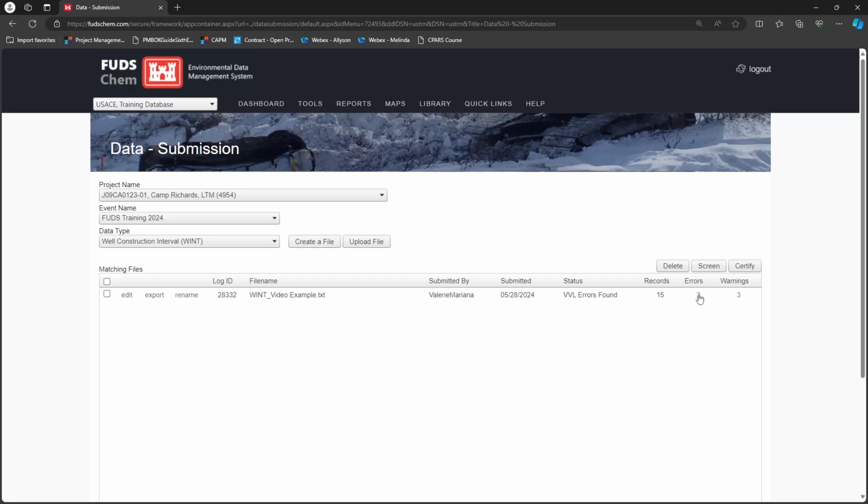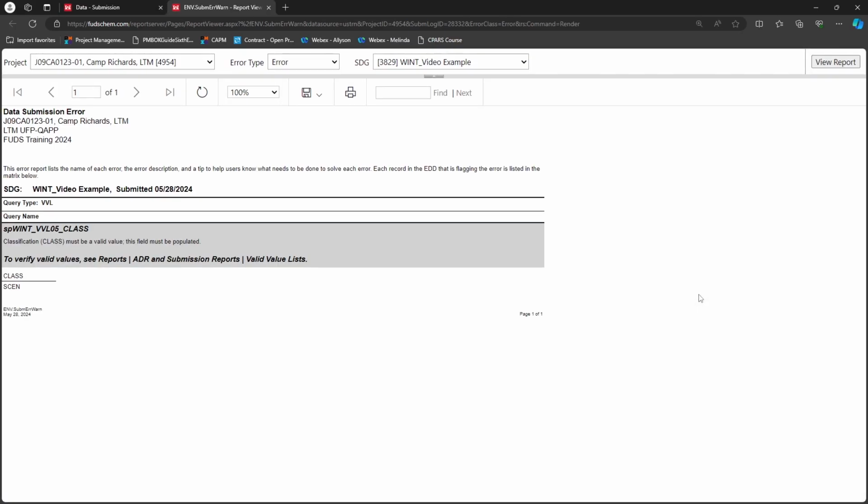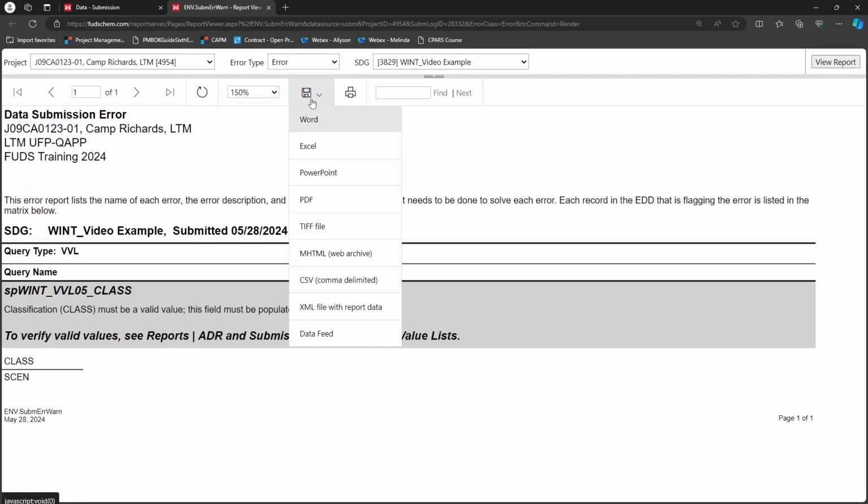Click on the number of errors to access the error report. You can save this report in various formats by clicking the floppy disk icon, or print it by clicking the printer icon.